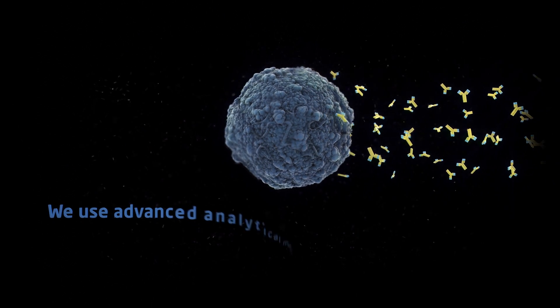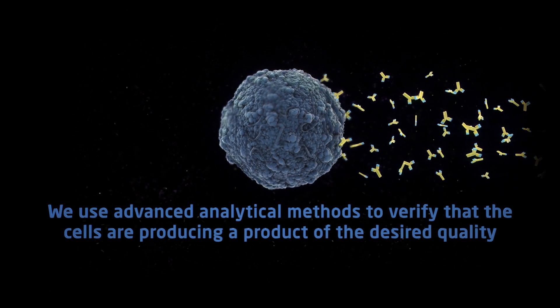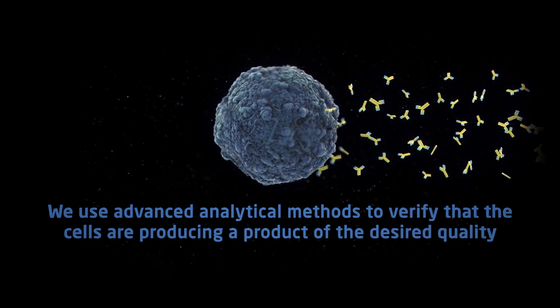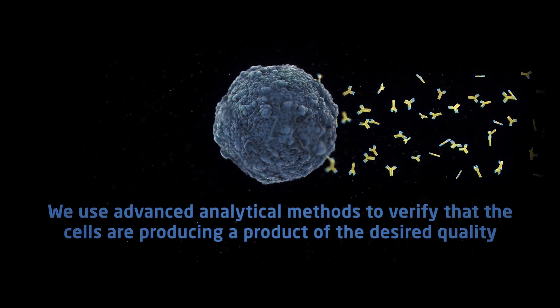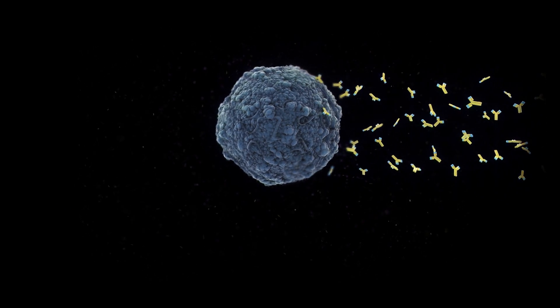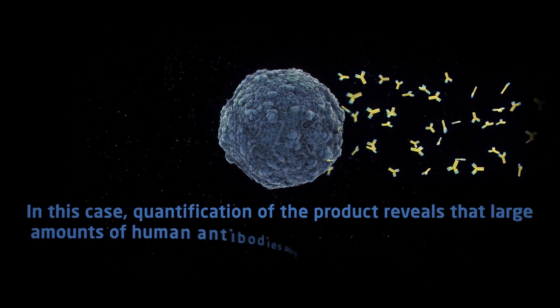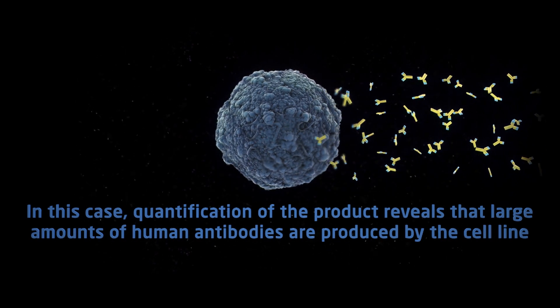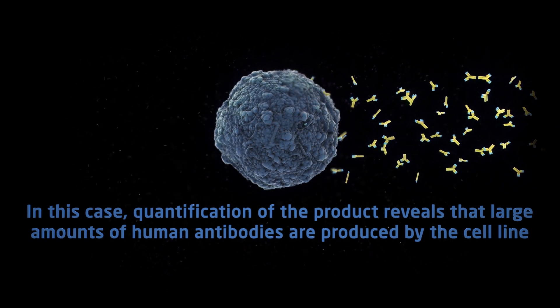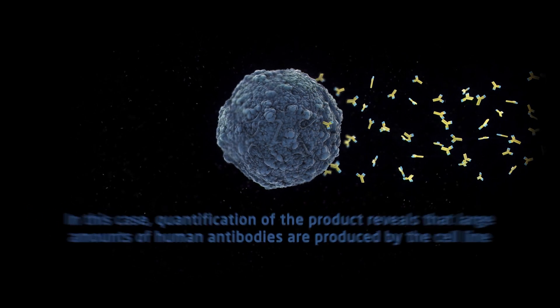We use advanced analytical methods to verify that the cells are producing a product of the desired quality. In this case, quantification of the product reveals that large amounts of human antibodies are produced by the cell line.